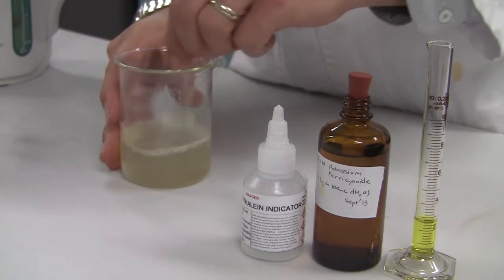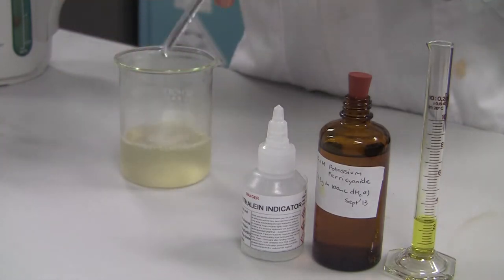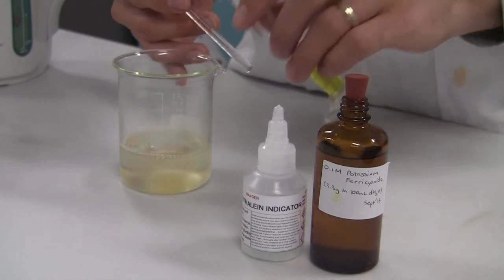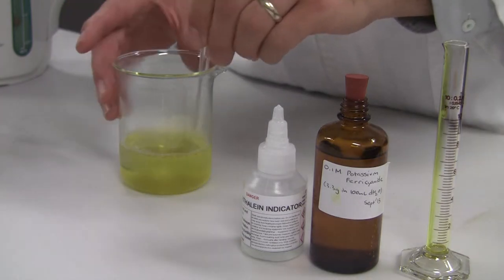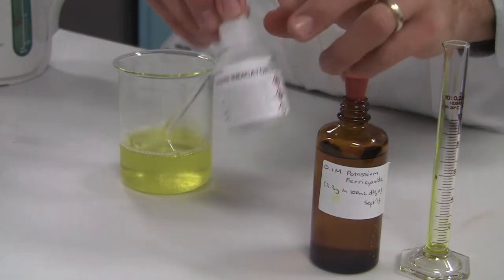The gelatin in question is just ordinary gelatin, but to that we've added a dilute solution of potassium ferricyanide and a little bit of phenolphthalein, about 10 drops.